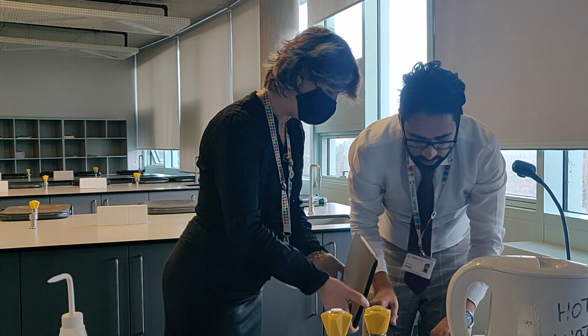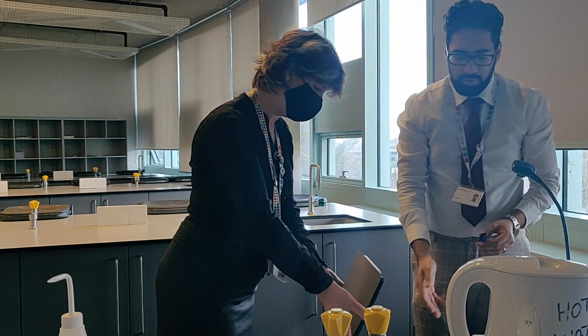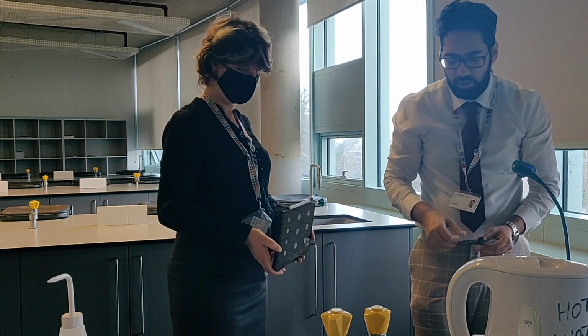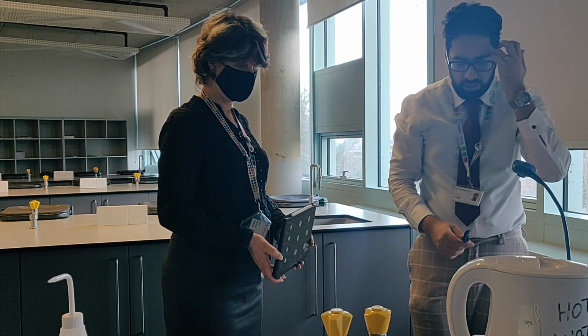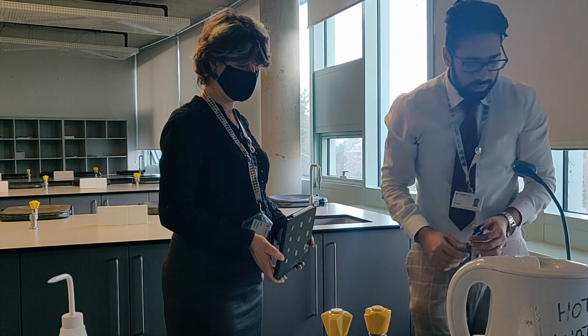I'm trying to drop it. Right, so it started at red again, and it's already becoming blue, even though I put it slightly further away from the ammonia solution. So you can see that that's what's happened there. So again, that's testing for hydroxide ions in aqueous solution. Right, that was test 4.